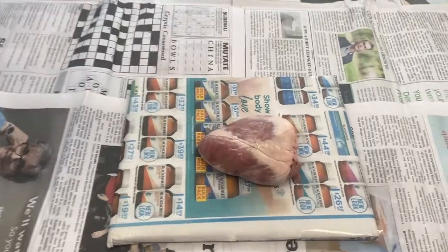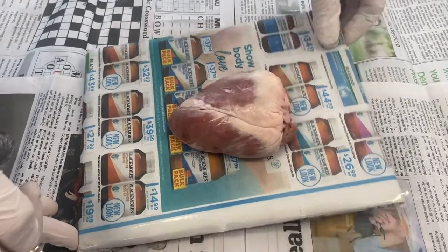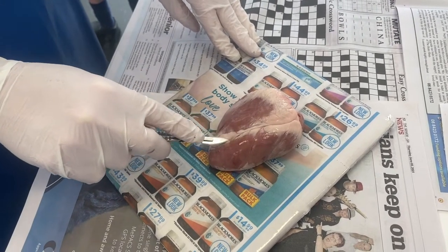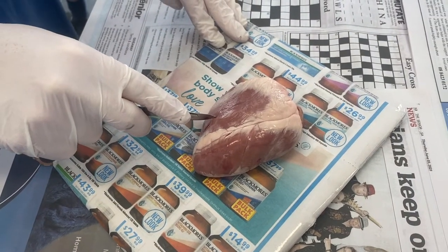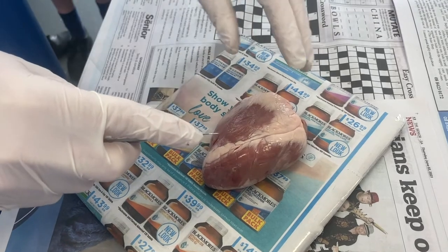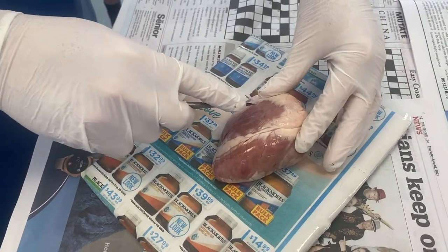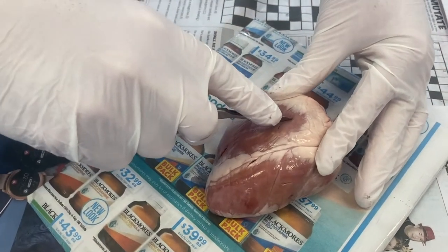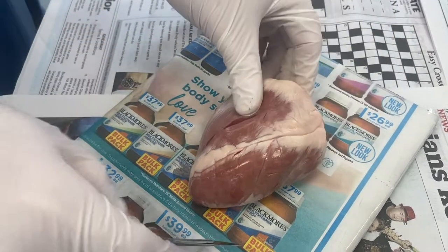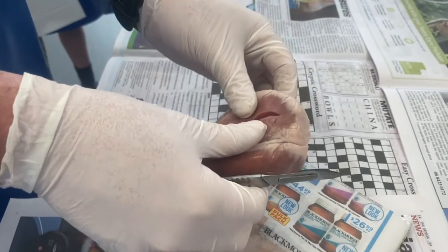Once you've got it in this position on your chopping board, you're going to make two incisions. If you're working in pairs, it'd be good for each person to do one. Get the chopping board nice and close, and we're going to run parallel to the septum through the muscular right side and the muscular left side. Don't go too hard or too fast, and make sure your other hand is clear but holding what you're cutting — thumb and index finger separated by about five or six centimeters, and make your incisions in between. Notice how easily this goes through the tissue with very little pressure — let the blade do the work.